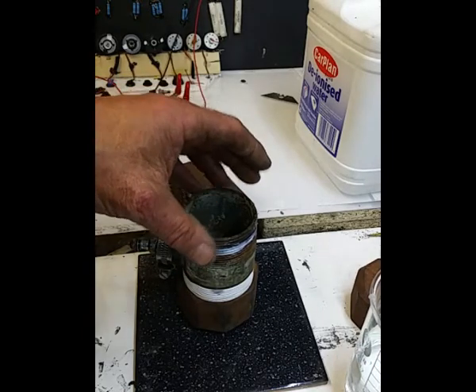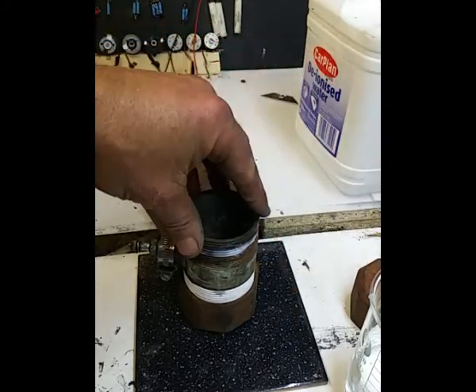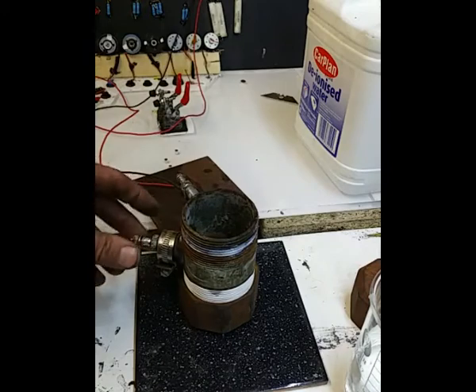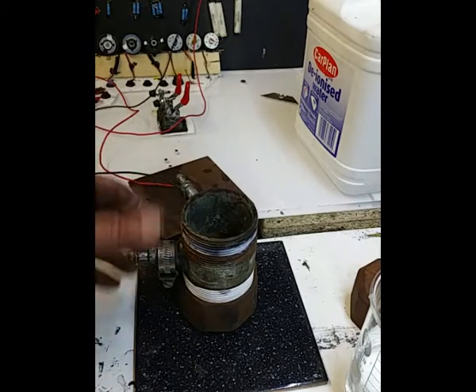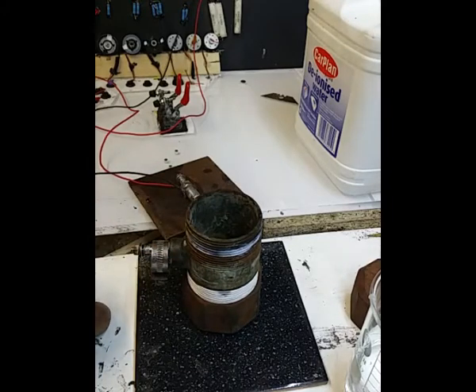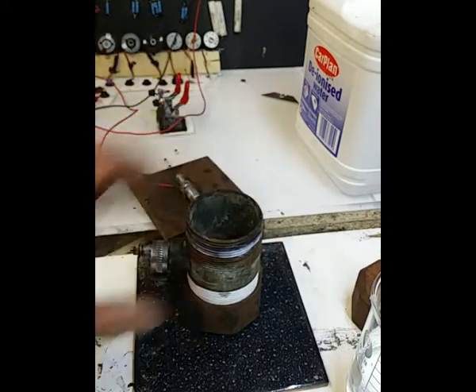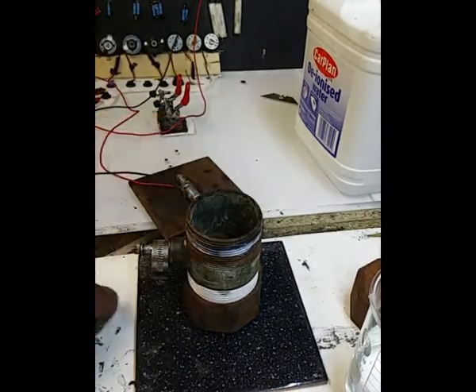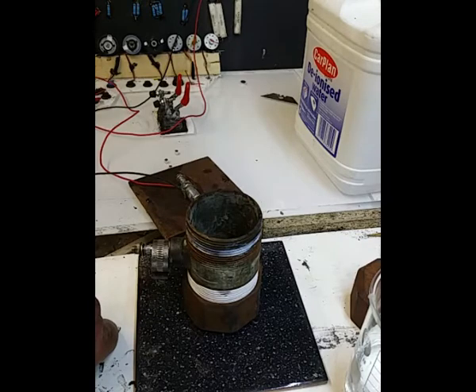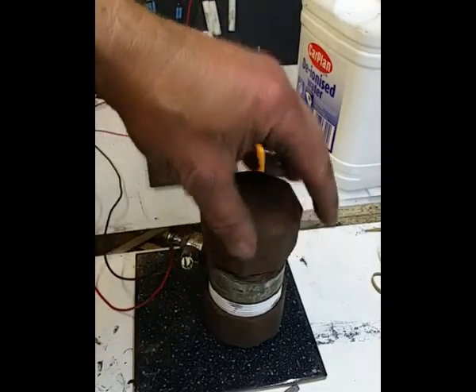So I'll preheat it on the hot plate with some hot water in it, and then fire this up. I don't know, maybe it would take half an hour to an hour to get up to temperature if you didn't do that. So it's giving it a start. I just want to see what sort of temperature we can get to and maintain, so that's what I'm going to do. So I'll pause the video for now, and okay, so what I've done, I've literally warmed this up.